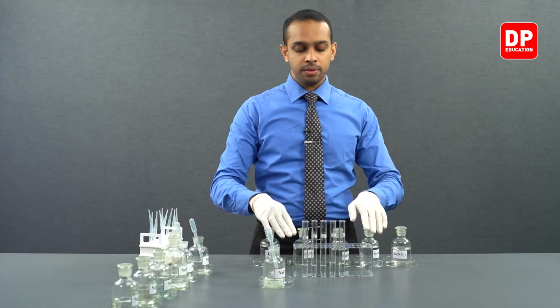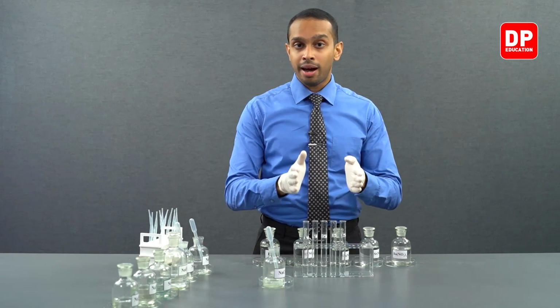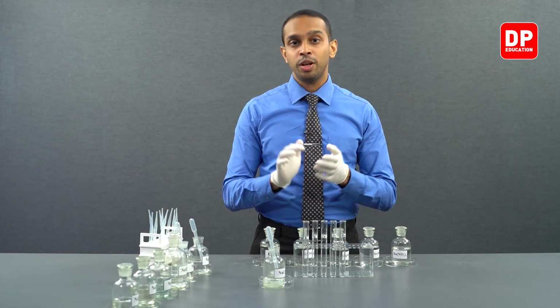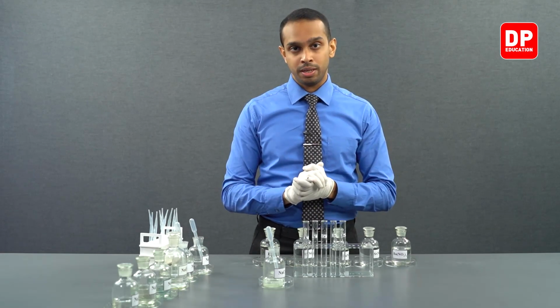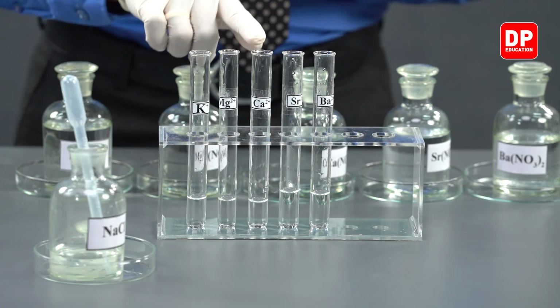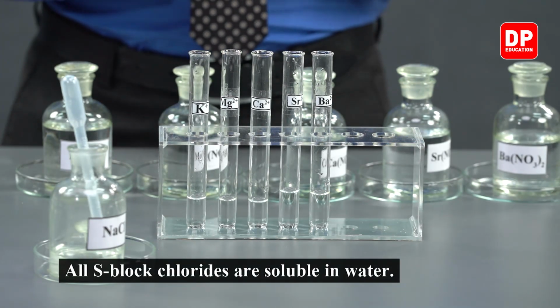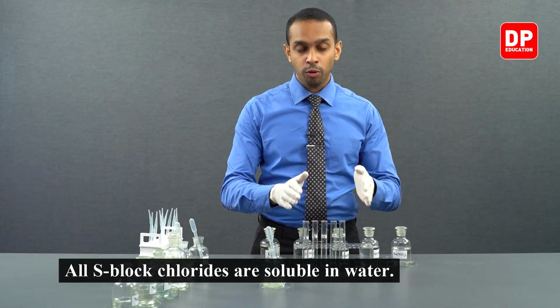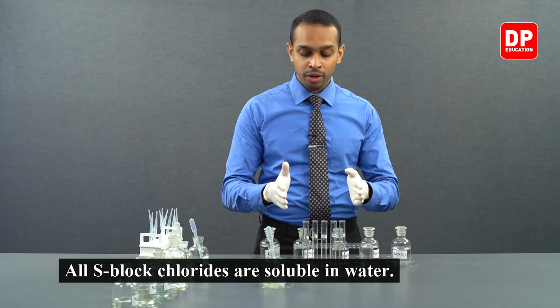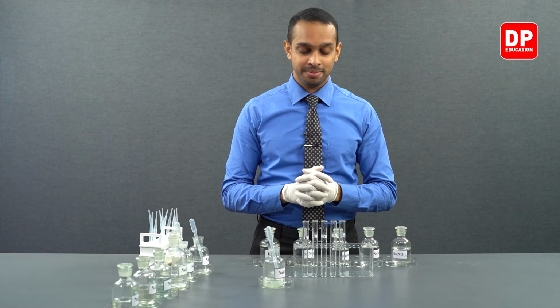As expected, when chloride ions are mixed with these cations, we will not be forming any precipitate. Potassium chloride, magnesium chloride, calcium chloride, strontium chloride, and barium chloride that are formed here are soluble in water. So therefore, you would not observe any precipitates formed here.